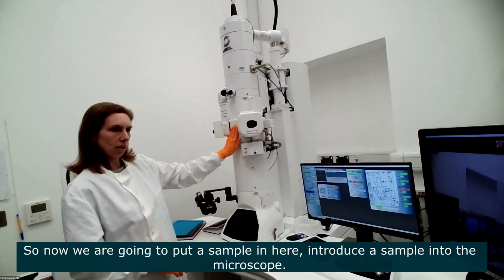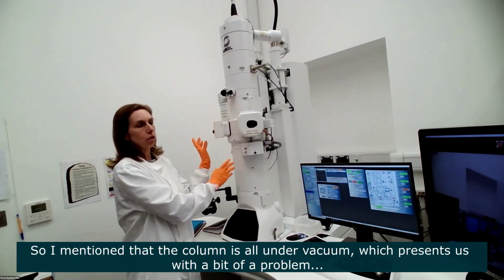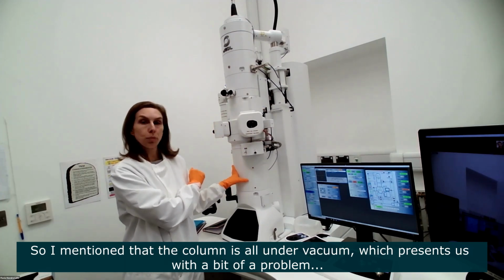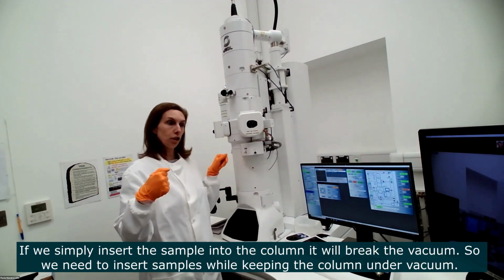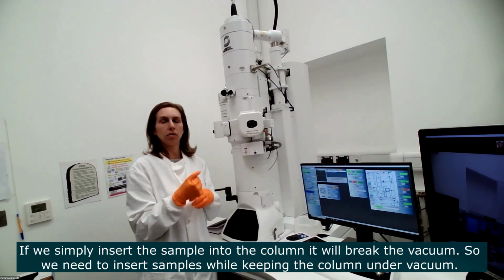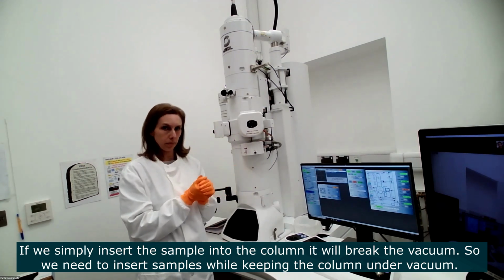So now we're going to put a sample in here. We're going to introduce a sample into the microscope. I mentioned to you that the microscope column is all under vacuum, which presents a little bit of a problem, because if we just insert a sample straight into the column, it would break the vacuum. So the column needs to remain in vacuum while we insert the sample.